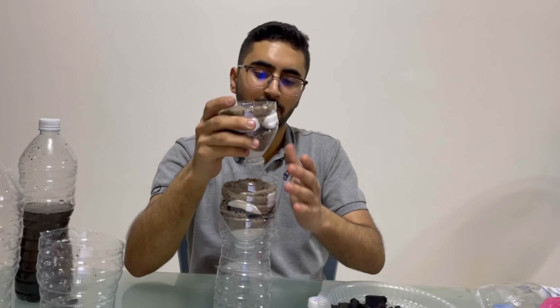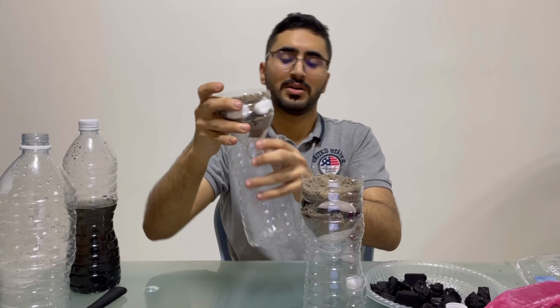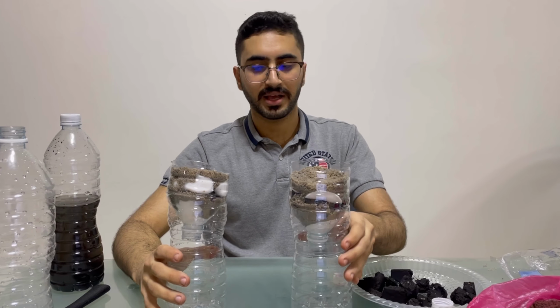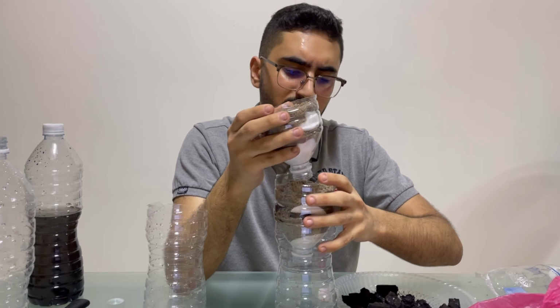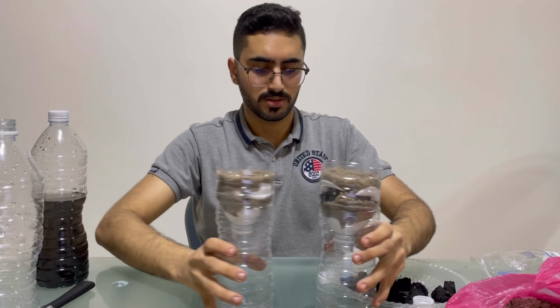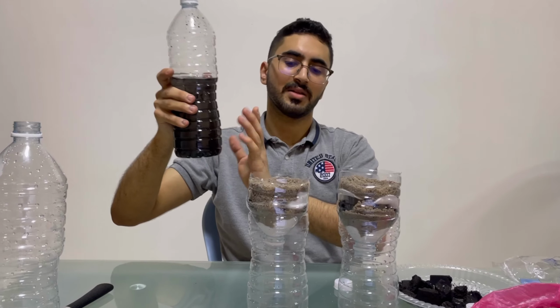Okay, then we can do it like this one or like this one. Do it just like two steps. Put the water here, then it comes out, put it here again. We can put it something like here, but I don't think the water will come out freely, so I will use it for two steps.